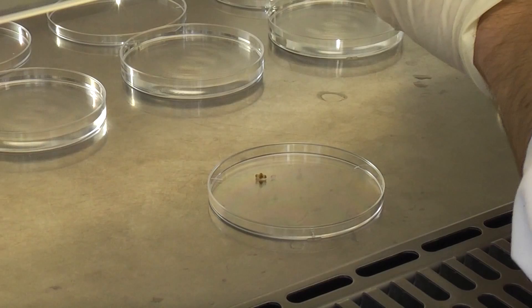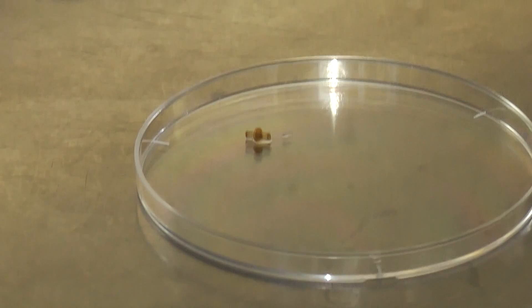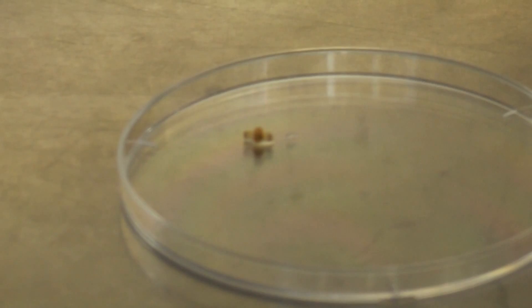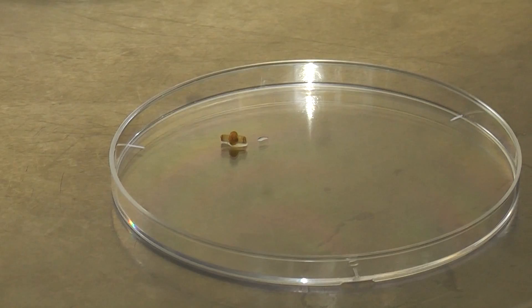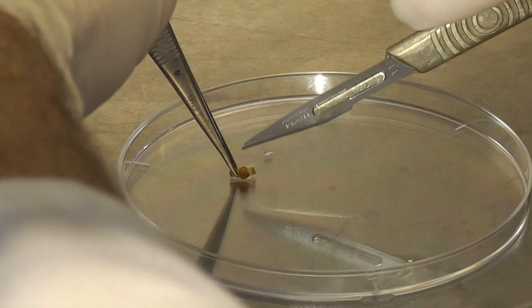So now I'll put the nodules on a clean petri dish lid. Just get a scalpel. And using the two I'll just cut the nodule open.